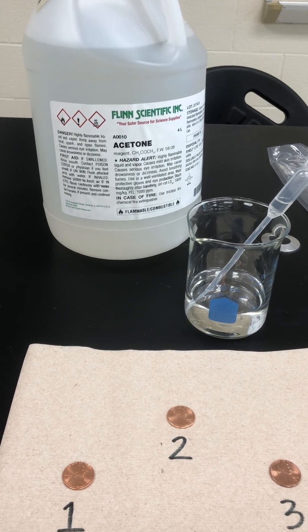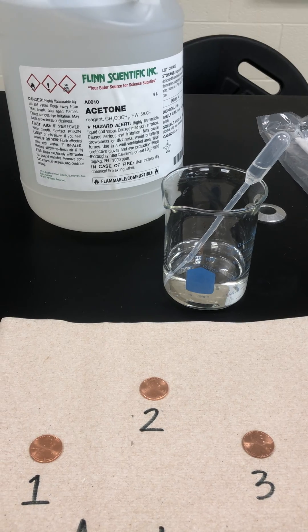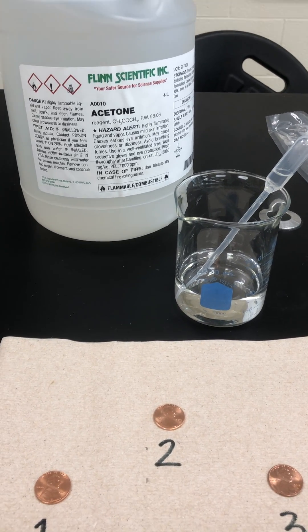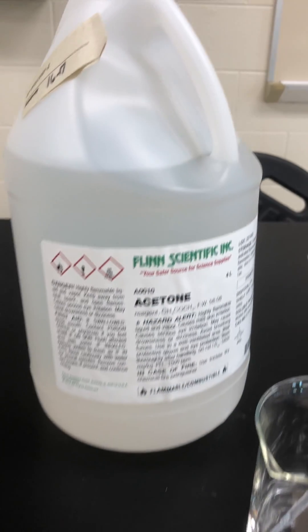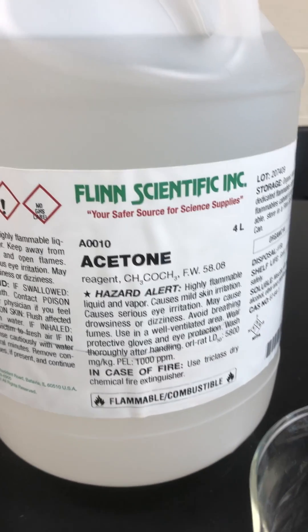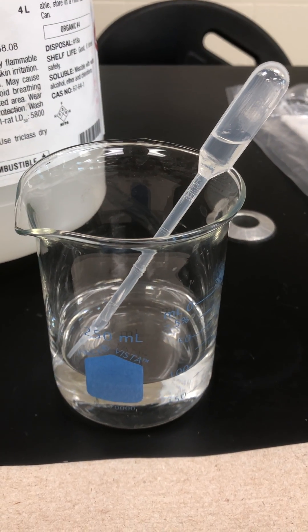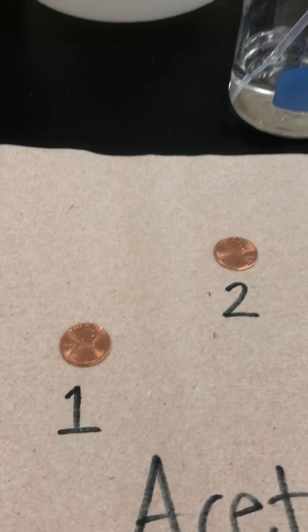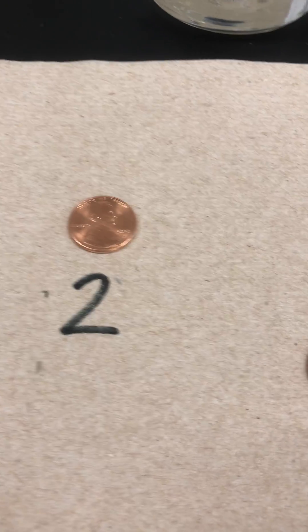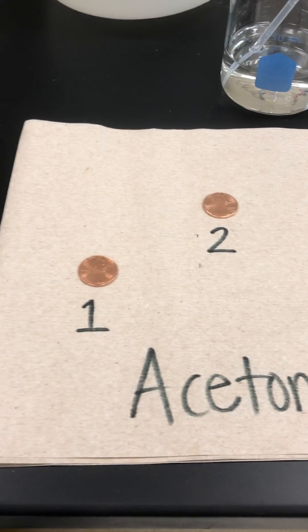Hello everyone! Welcome to my makeshift chemistry lab here in room 8014 at Stevenson High School. I'm going to demonstrate drops on a penny for you with acetone. Here's my big container of acetone — I've poured some into a smaller beaker with a dropper, and I've got my three pennies here. They're all heads up and we'll do three trials of the acetone.